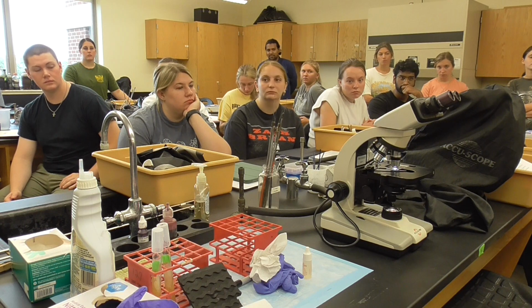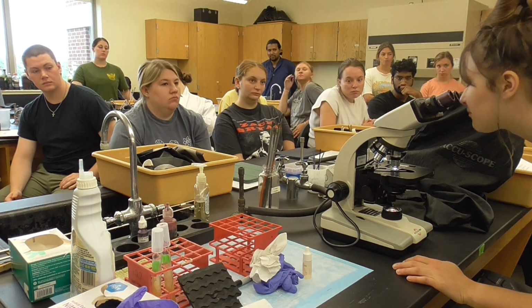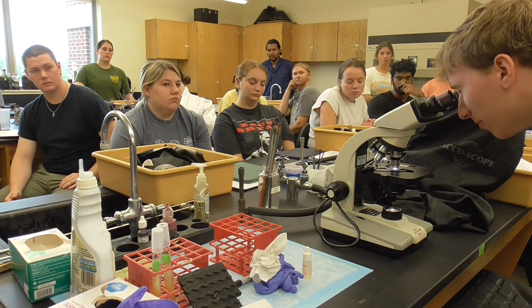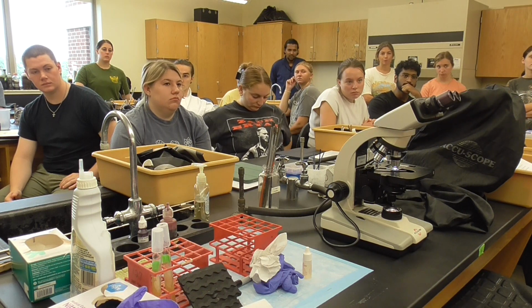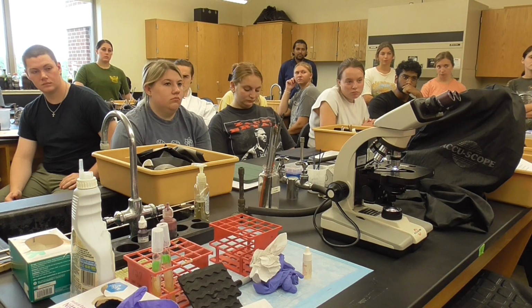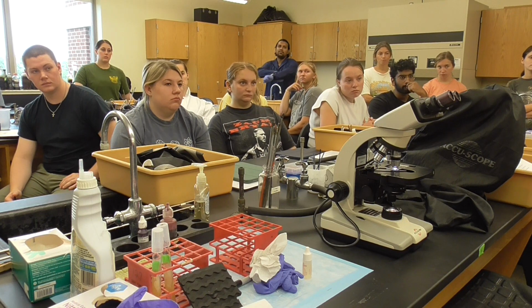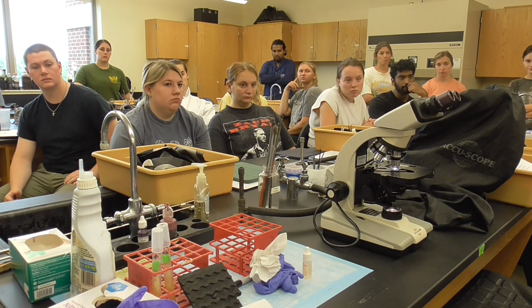You go ahead and see it again. I just simply move to the left side. See, that's a coccus, but lactobacillus is supposed to be a rod. So that may have gotten contaminated with something that looks like grape shape, Staphylococcus aureus. So you can just take a picture and record in your notebook what it is. Then we'll see, because it happens, sometimes the slant is getting contaminated because the strain is getting old.